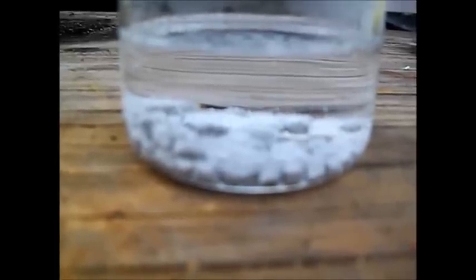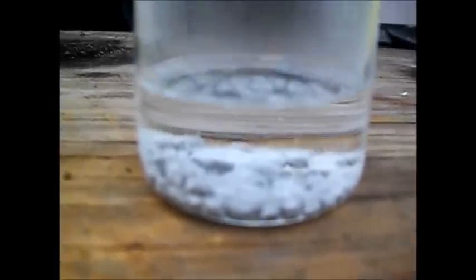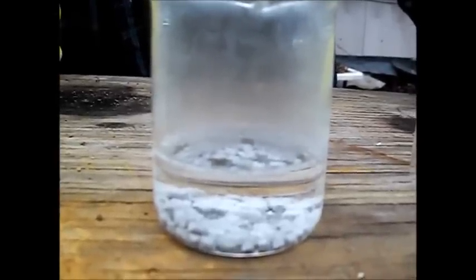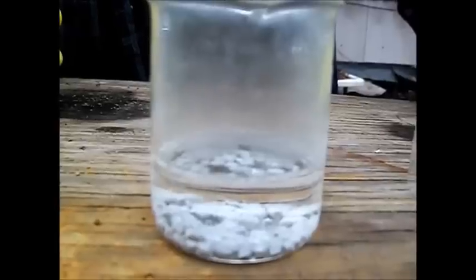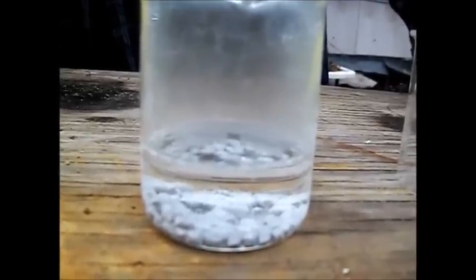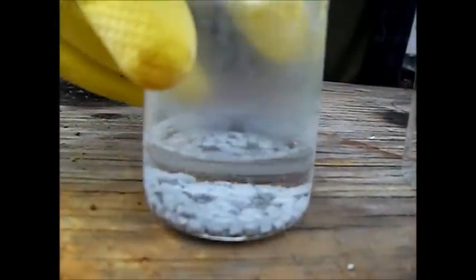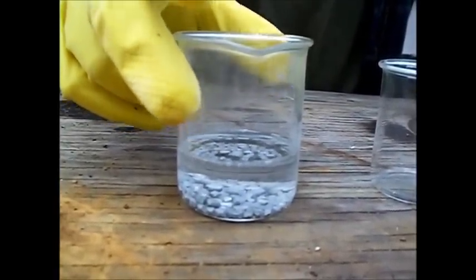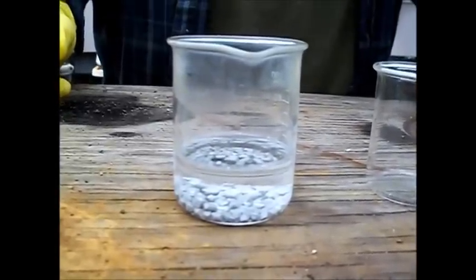Now this reaction will get more aggressive, more vigorous. As the reaction goes along, the solution starts heating up — it starts building its own heat. So you can tell that after just a few moments it's working pretty good. I'm going to let this work for a little while, and then I'll come back and pick back up on it when all the metal is dissolved.